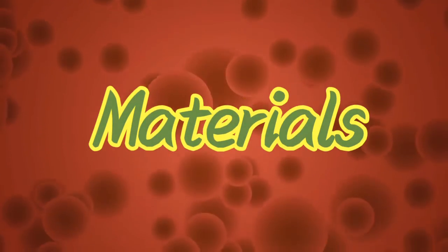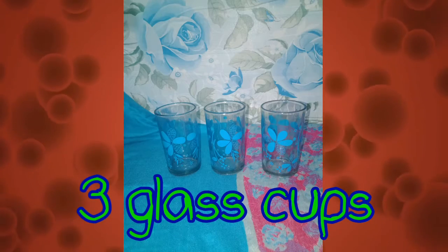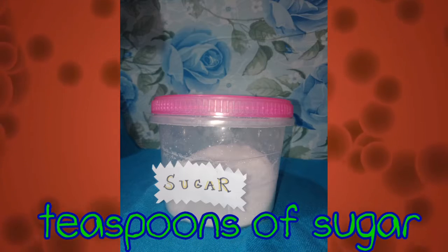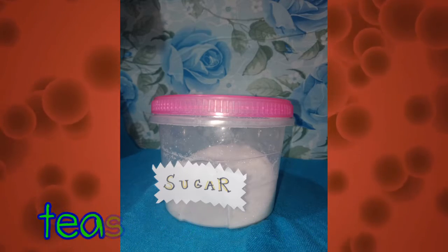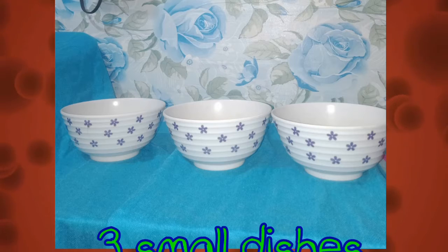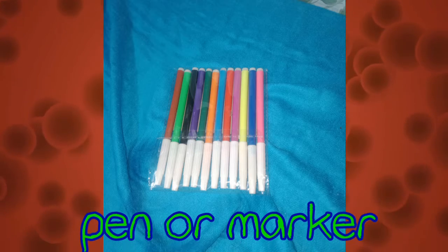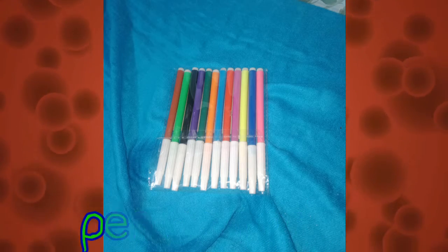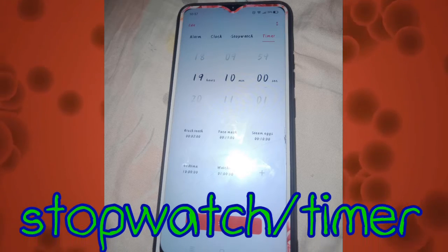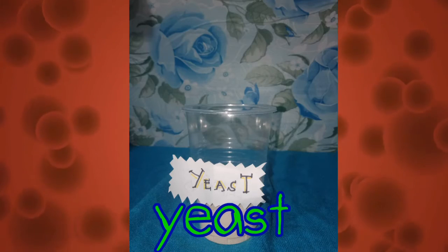The materials we will need are 3 glass cups, 2 teaspoons of sugar, water, warm and cold, 3 small dishes, a pen or marker, a ruler, a stopwatch or cell phone timer, and of course, yeast.